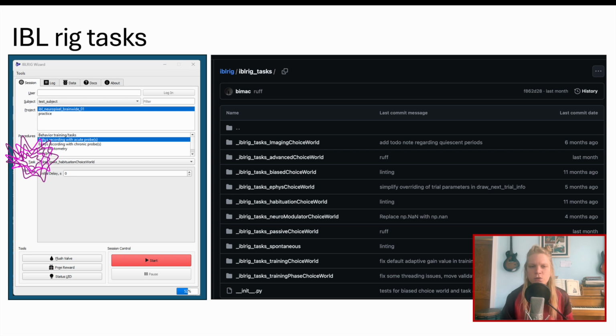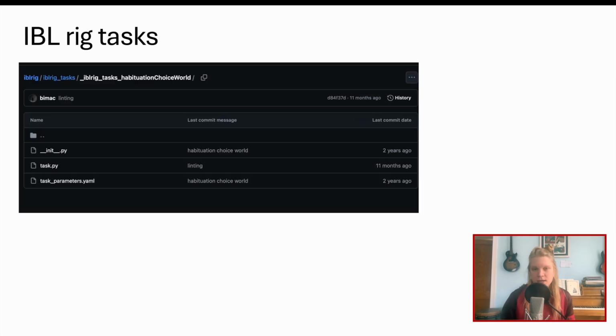I recommend habituationChoiceWorld as a place to start, as its structure is quite minimal compared to the parent classes. This task is set up for habituation prior to training, so it's not mouse behavior oriented and thus has a simpler structure than, say, training phase or biasedChoiceWorld. So let's take a look inside habituationChoiceWorld. Each task folder contains the task code, which in this case just calls on the class of the same name in the IBL file baseChoiceWorld, where we'll get in a moment.